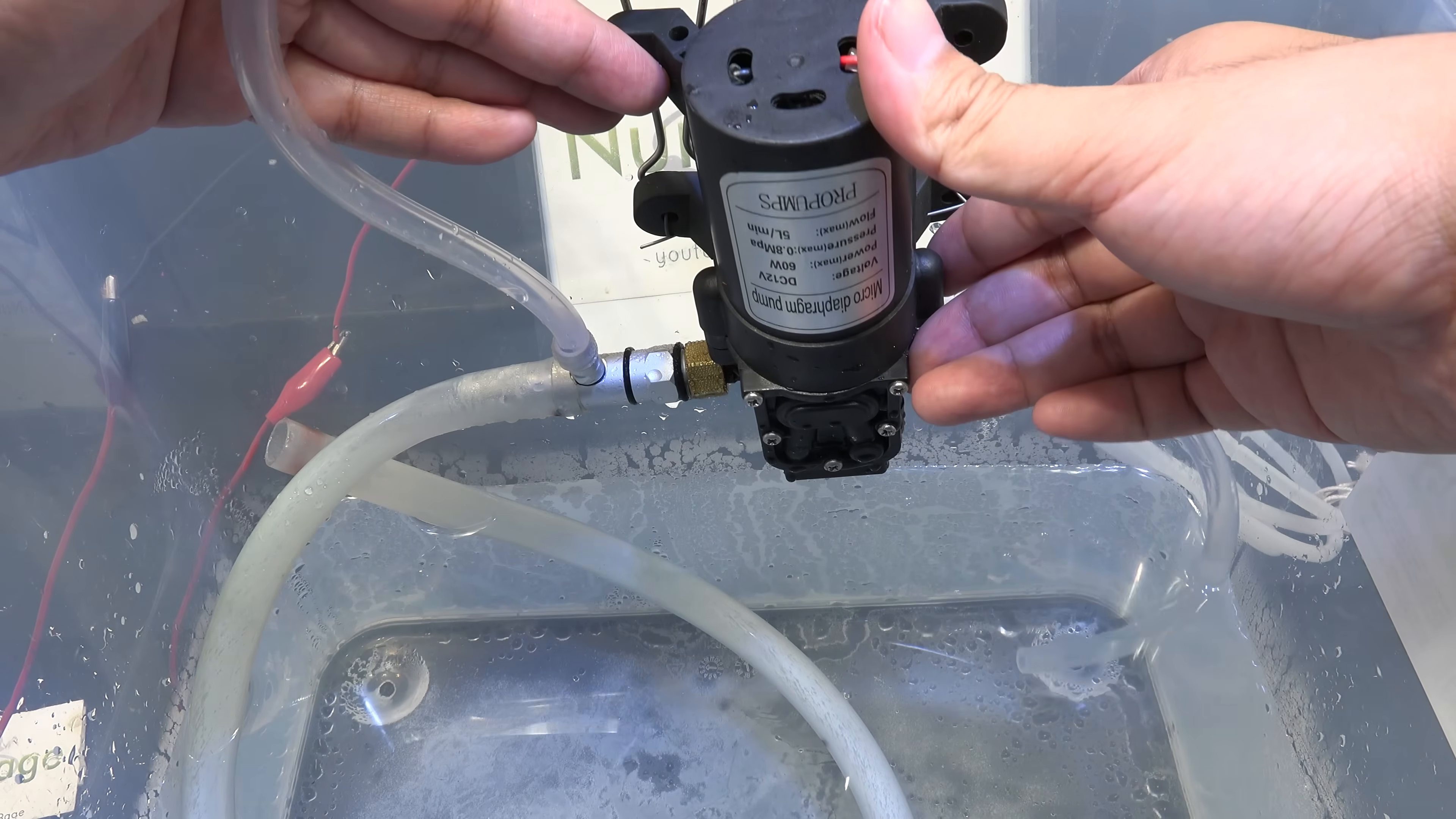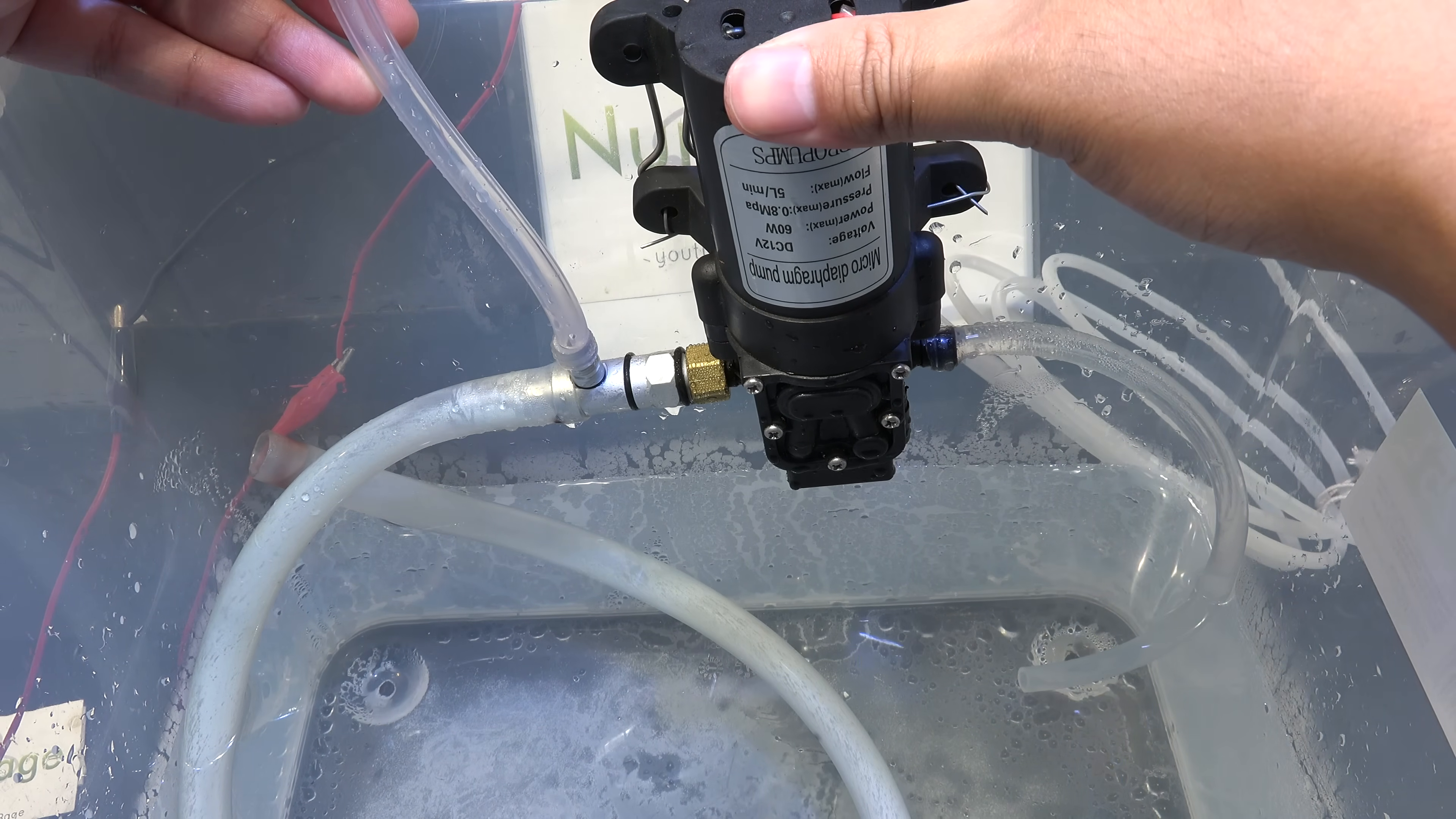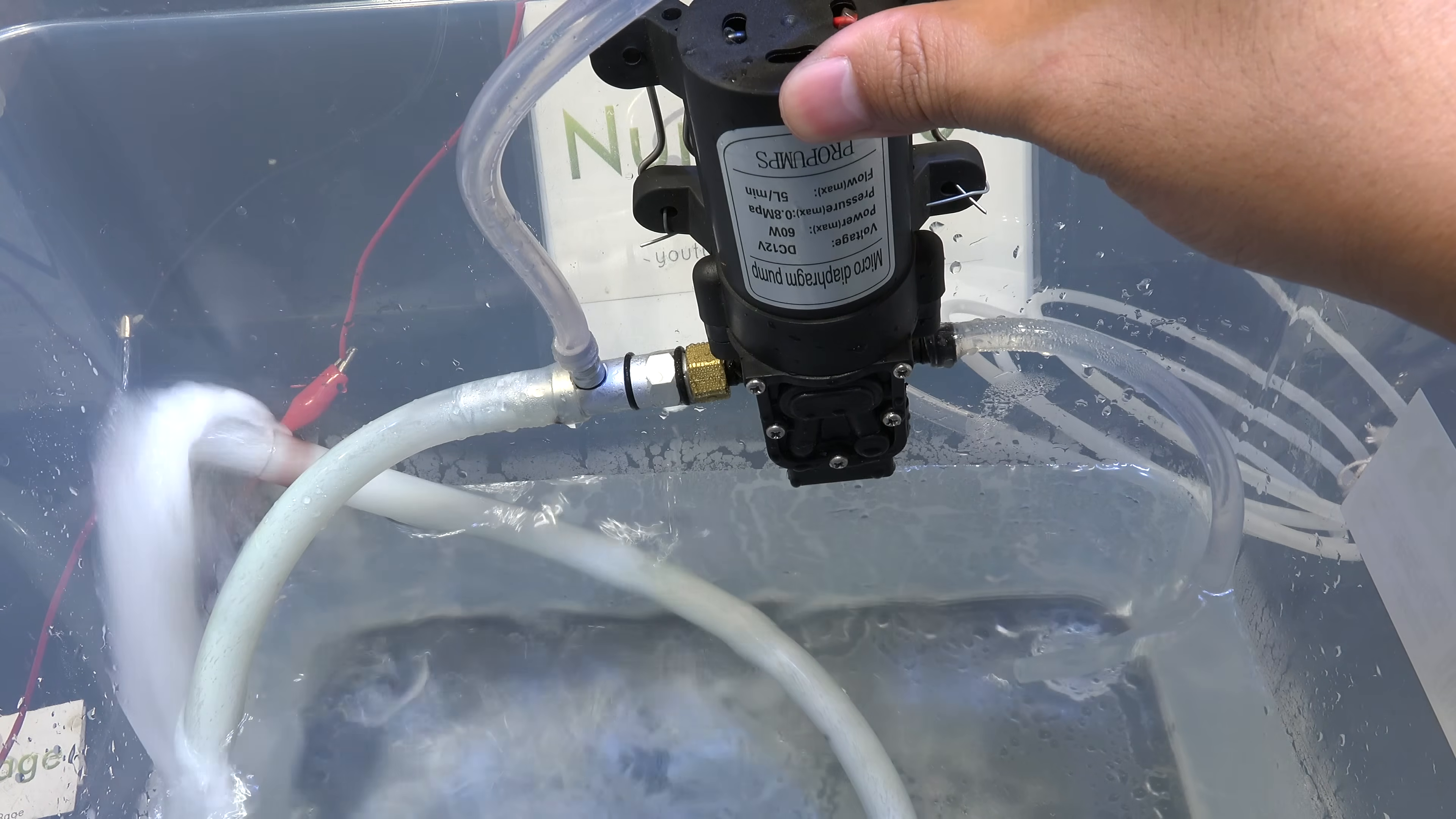The pressure is increased to 100 psi inside the pump and forced into the aspirator here. The aspirator starts pumping vacuum now and ejects waste water through this larger tube and flows back down into the reservoir. You actually don't need this tube at all and can just let the water eject against the side of the bucket. But I find this tube to be cleaner and quieter with less splashing. Let me turn it on to show its operation. And there you go.